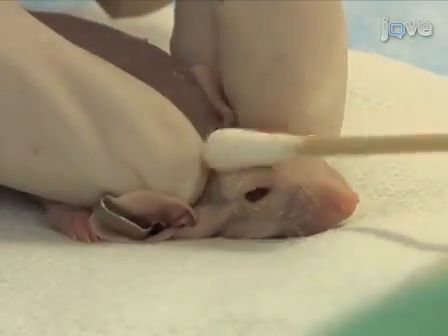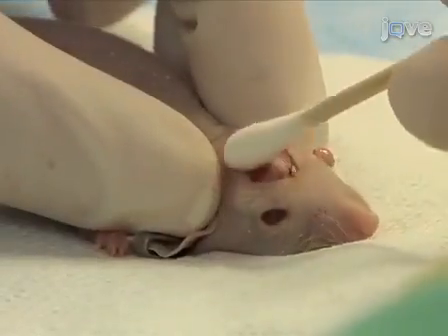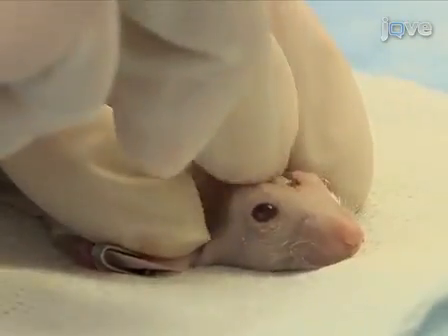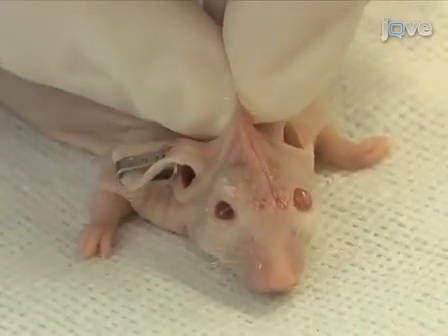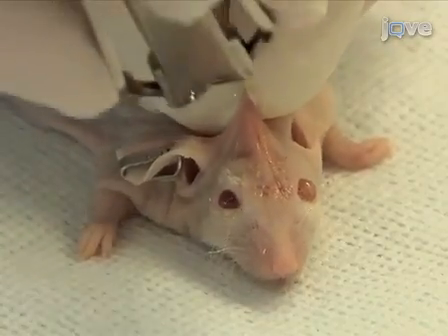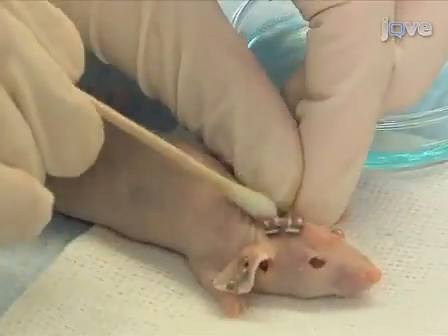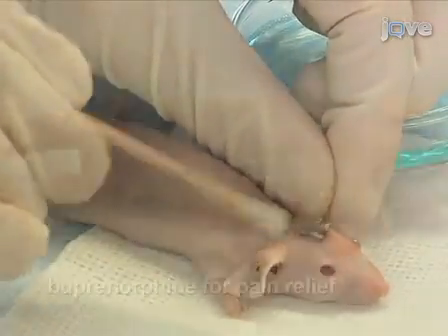Clean the skull with 3% hydrogen peroxide and dry using a sterile cotton swab. Apply sterile bone wax to the hole. Using forceps, draw the scalp together over the skull with the dermis of each side pressed together, underside against underside, and staple. Then clean the scalp using chlorhexidine.